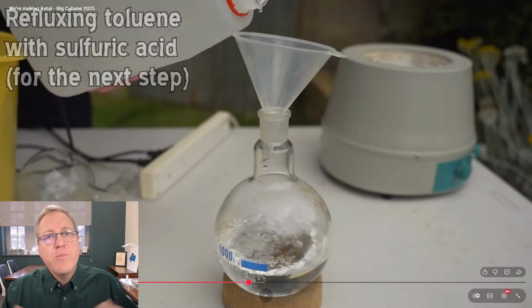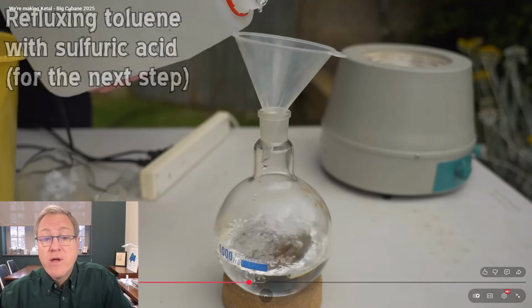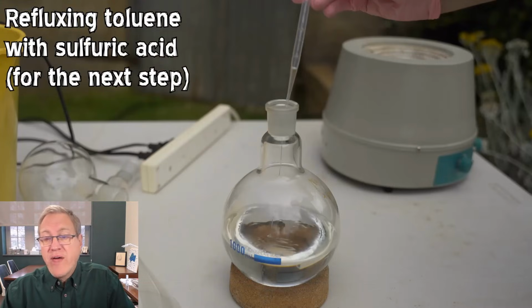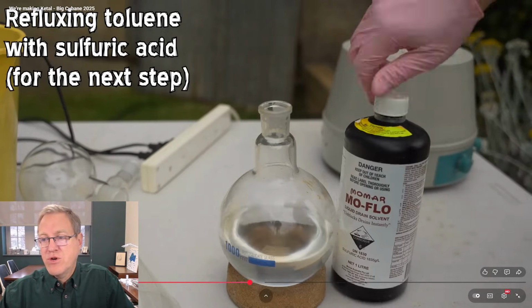Okay, I have to start with some mute because he has some montages going on and he has music overlays that, I think, will give me a copyright warning. So let's start. He is pouring toluene. The bulk of what's in that flask is toluene. That's going to be the reaction solvent. And with a pipette, he's adding some sulfuric acid. So let's see, he'll show that.